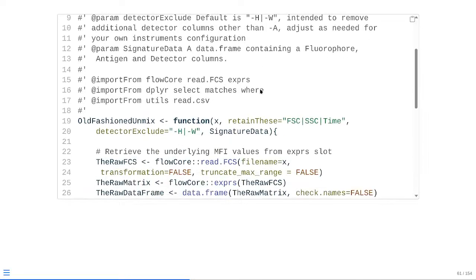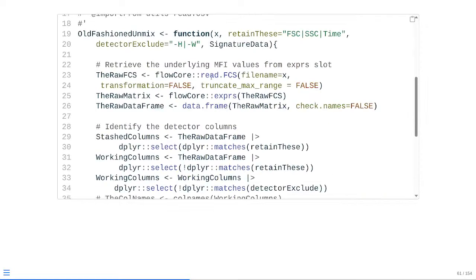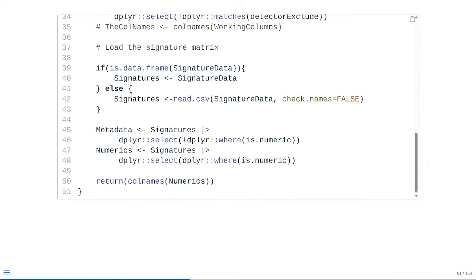So what this is going to look like, well, we're adding in some additional new dplyr dependencies, so we need to update those in the Roxygen skeleton, and same thing, the base package utils, read.csv that we had a little bit earlier. And then down here, right after we go to our conditional statement, we're basically separating out our metadata from our numeric columns. In this case, piping signatures to the select function, which is using where and is.numeric to identify things that are numeric. If it's a numeric column, it will evaluate as true, but that little exclamation point will flip it to false, and it won't be retained. So only character/logical columns will end up being stored within the metadata.